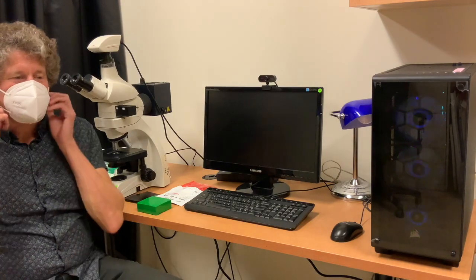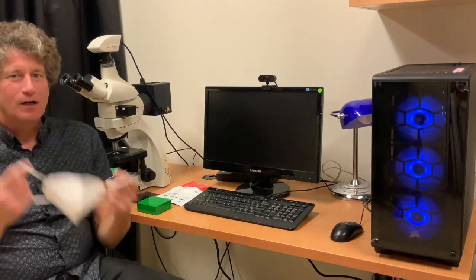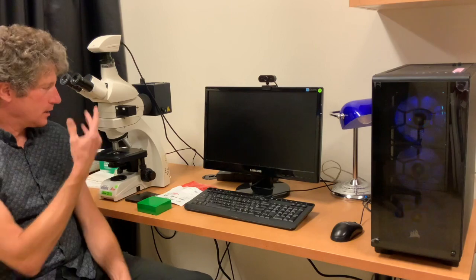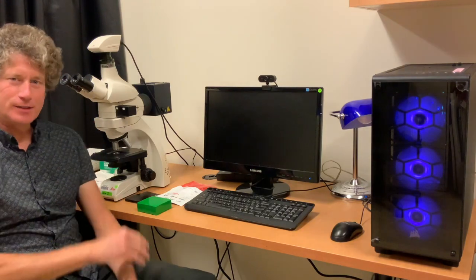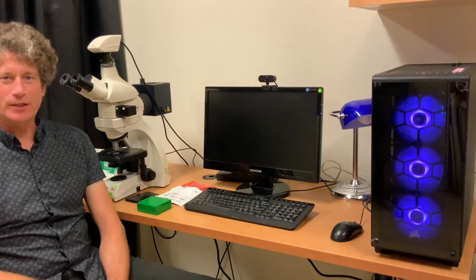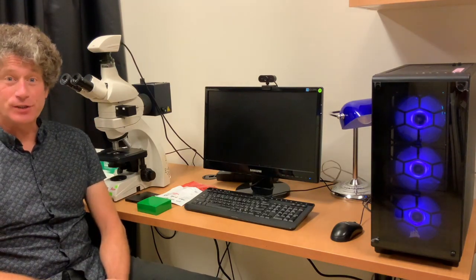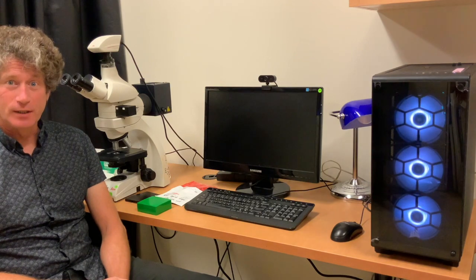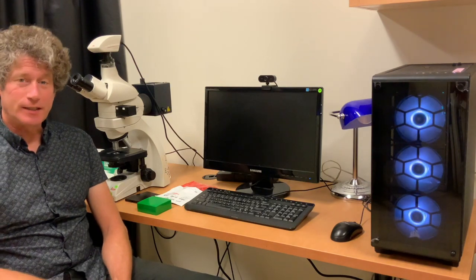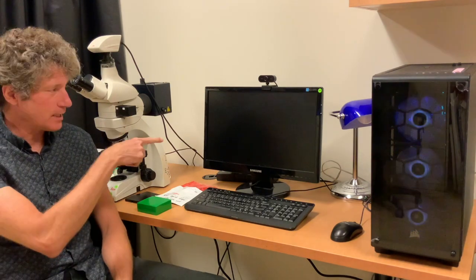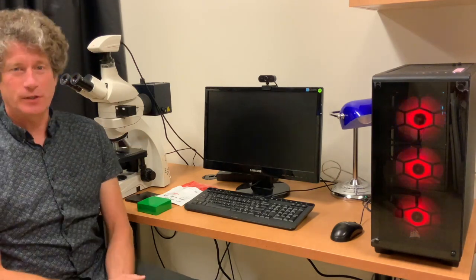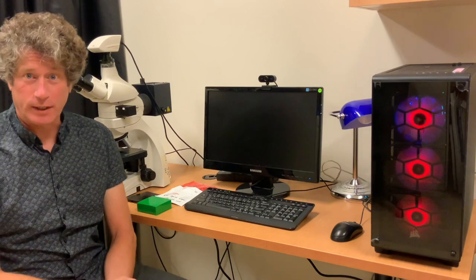Hello class. This is your introductory tutorial on the Leica DM500 microscope, covering how to turn it on and the basics of getting everything going. Later, I'll step onto the computer and show you how to run the software.